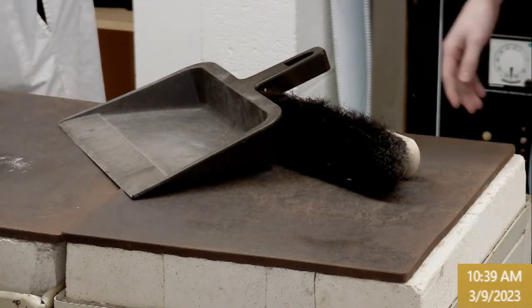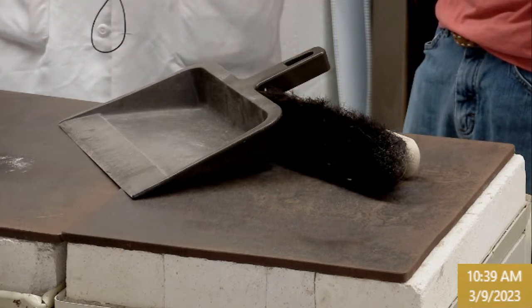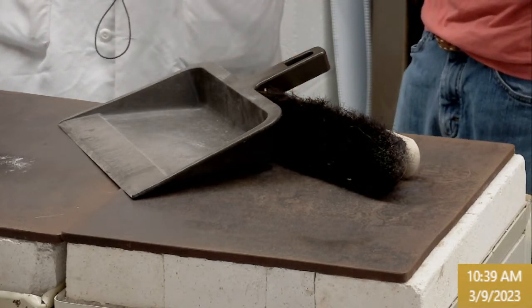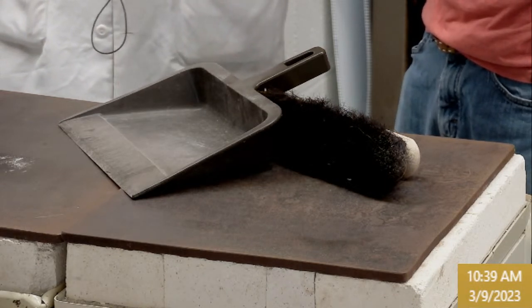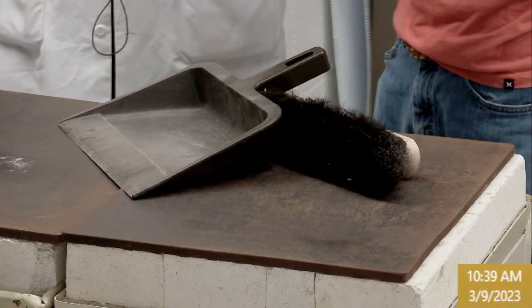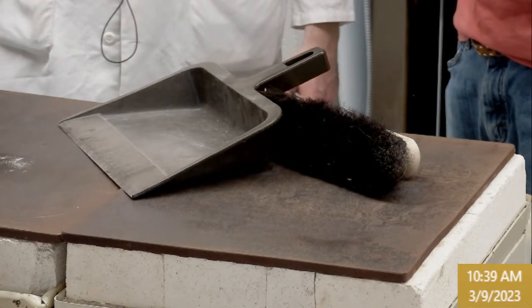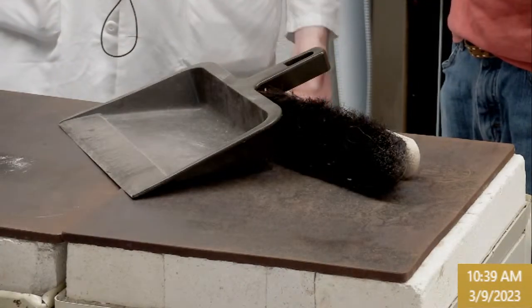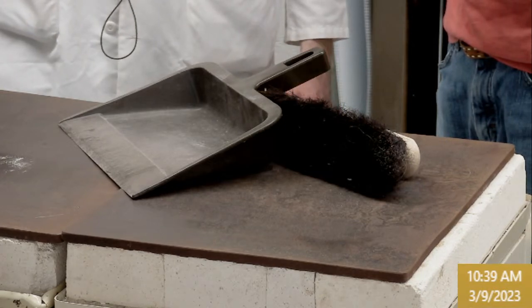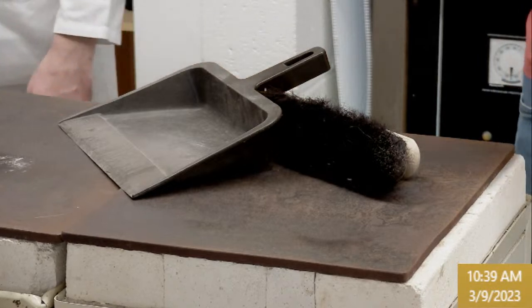Yeah. What is this compared with, a viscosity rating? So that would be compared to disc A in that picture. You can get kind of an approximate diameter to compare with these. And A was in a few pictures up in the pre-lab. That's, I guess, a different document if you don't have the instructions. But yeah, that one. If you scroll down a few pages, A is right there.